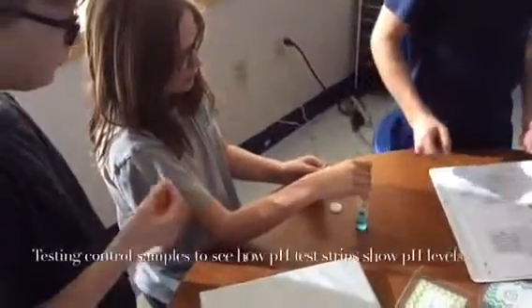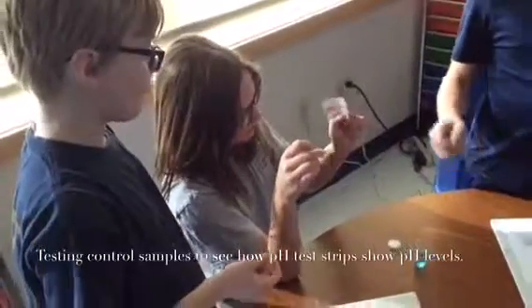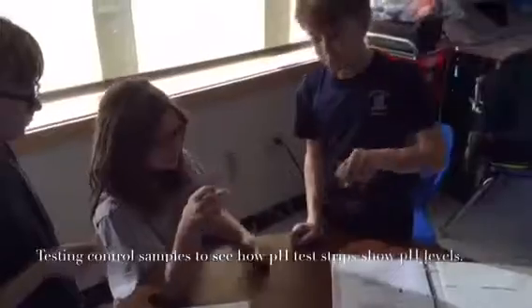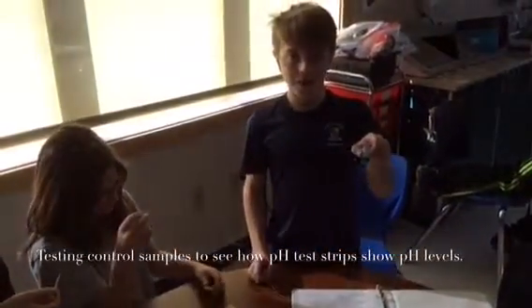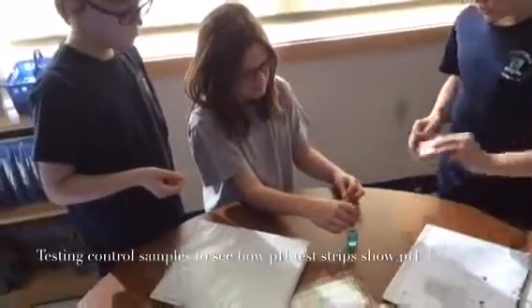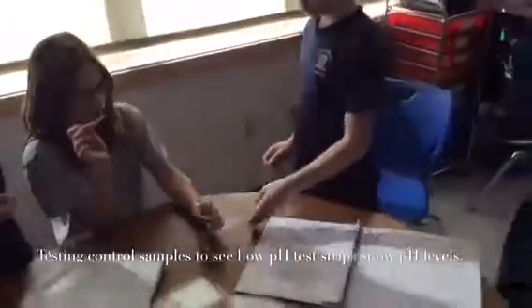Neutral in that kind of 6.5 to 7. What are you guys doing? Testing pH. Testing these to see if the basic pH is more acidic or more basic. And it's 12. And that is more basic.